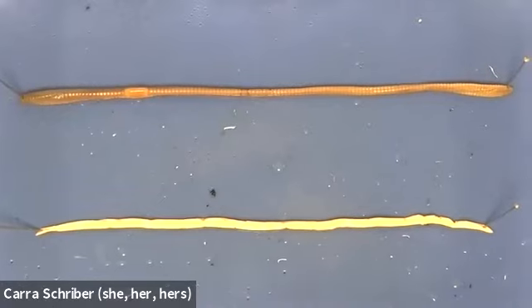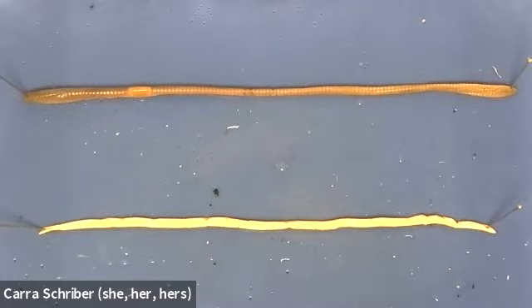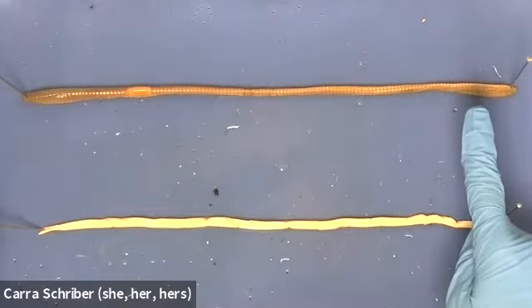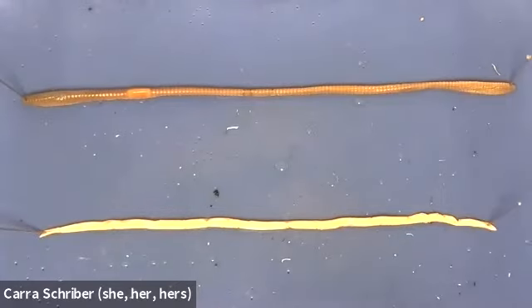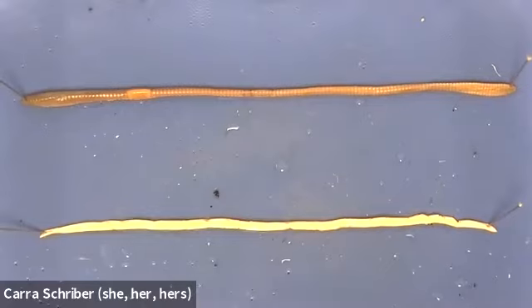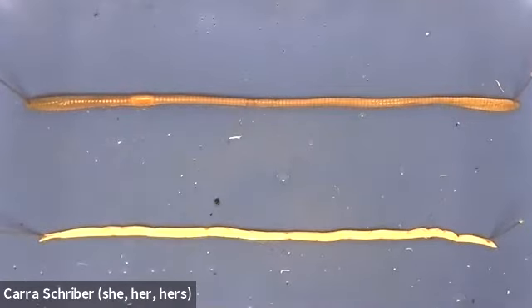Both of these organisms are going to have a complete digestive system, which means that you have a start and an end to the digestive system, right? The mouth, then down the length of the organism are generally the digestive organs, but a lot of that is intestine, and then we finish off with the anus. I picked 2 specimens that are about the same size, but generally they're not going to be exactly the same size like that. But it's nice for our comparative study here.